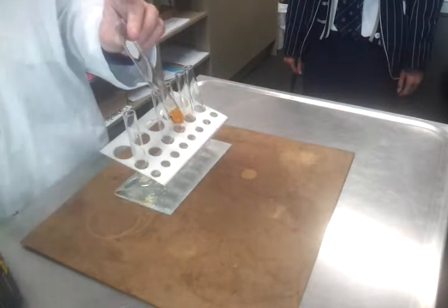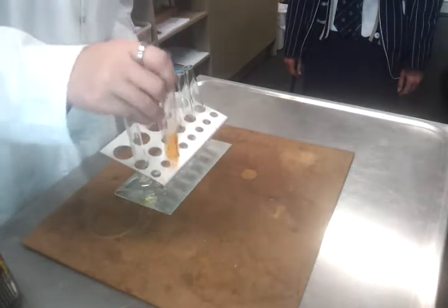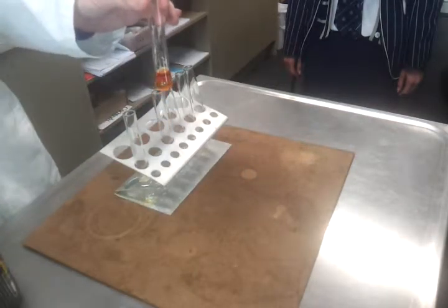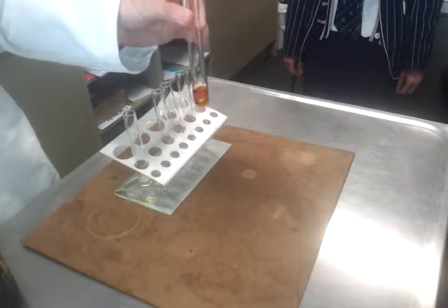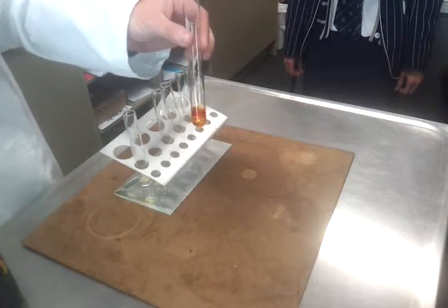Now remember, this is bromine water, so the bottom layer is going to be the water part, okay? And if we shake it up a bit, we can see that the bromine has been pulled into the top layer because it dissolves better in a non-polar solvent, but it's not actually changing colour, all right? Which means it's not doing the reaction that I just described. There's nothing happening.